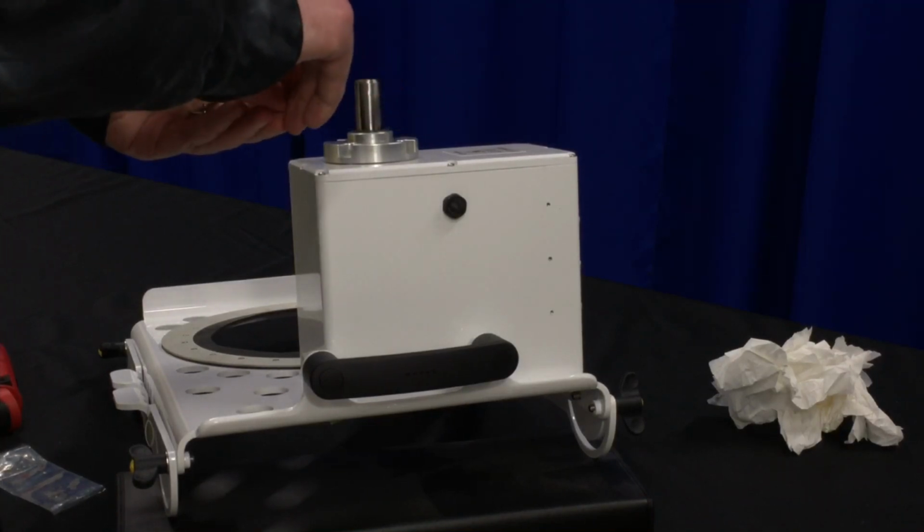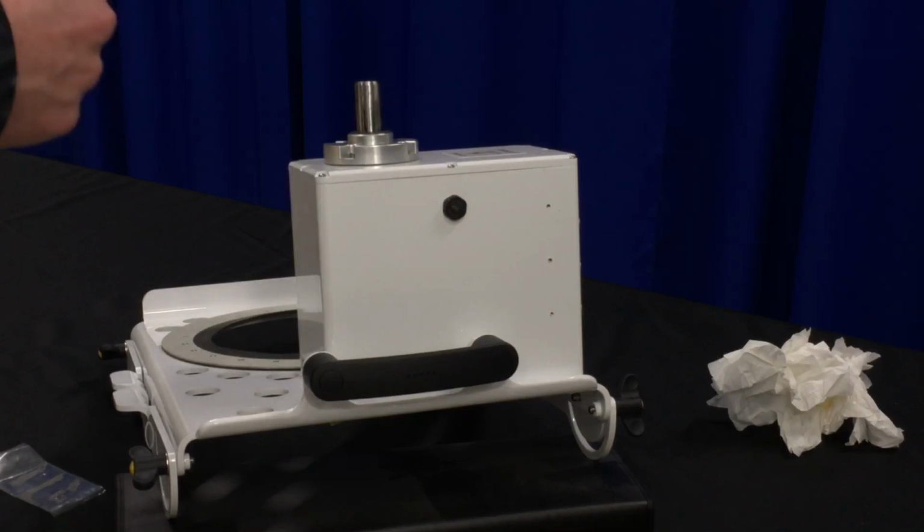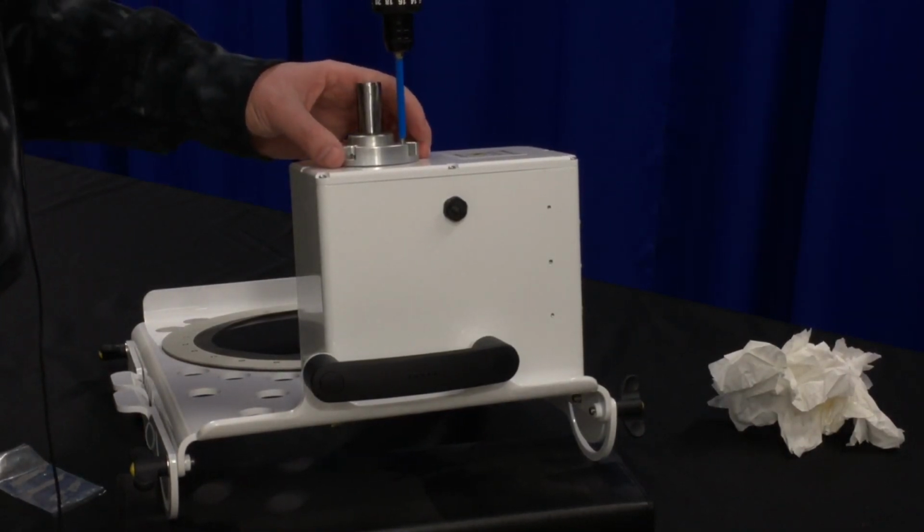So what I like to do is just put the washer on the screw first. And then when it's time to screw them in, not a lot of torque is required.